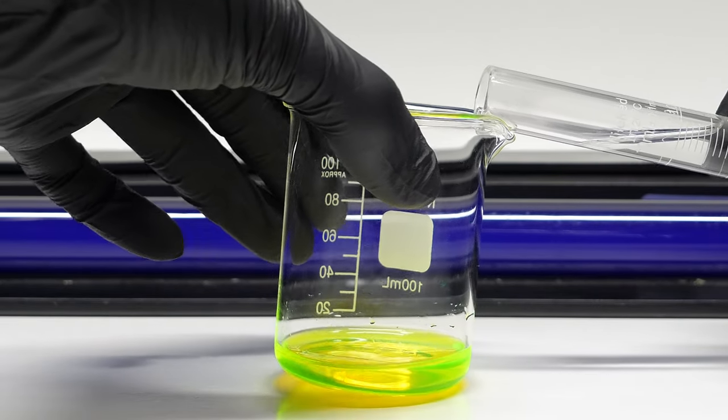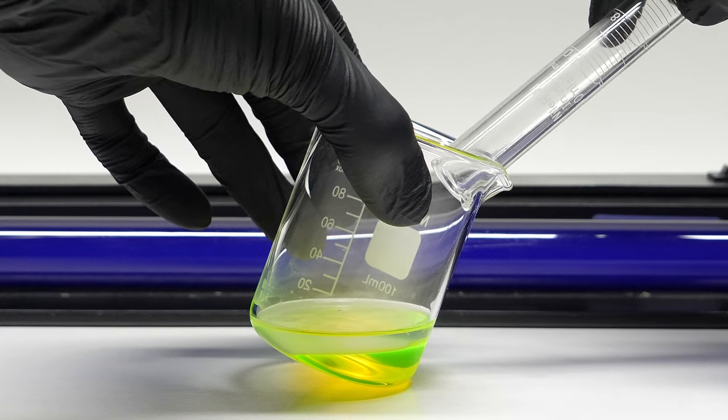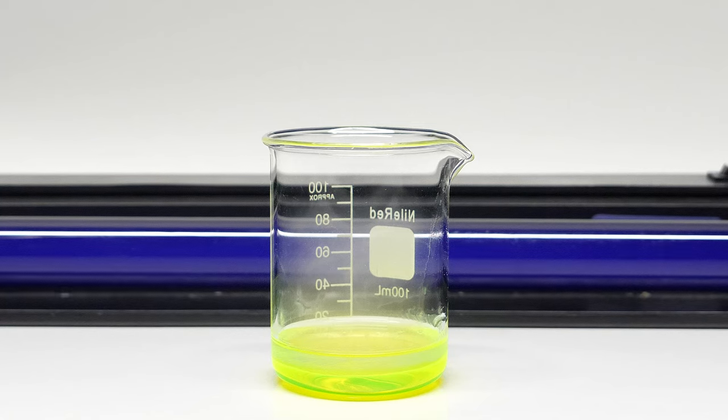I can then carefully add the second solution on top, again making sure to not let them mix. After this, I should be good to go, and I can turn off the lights.